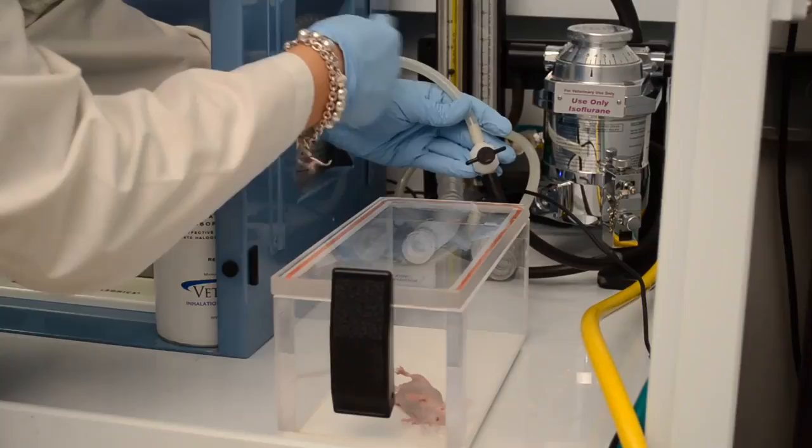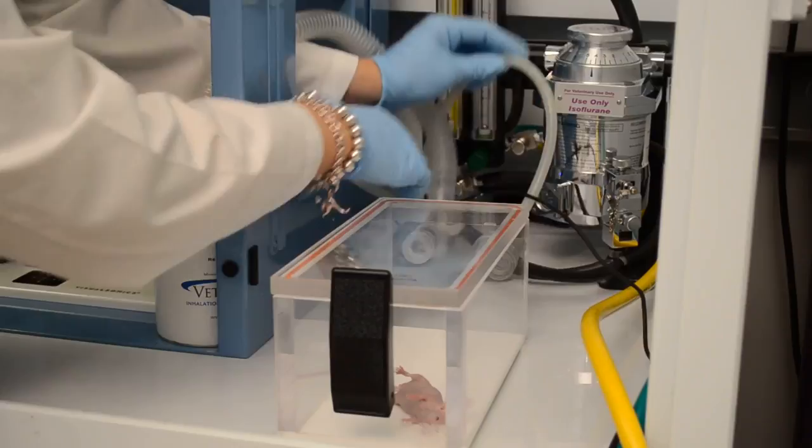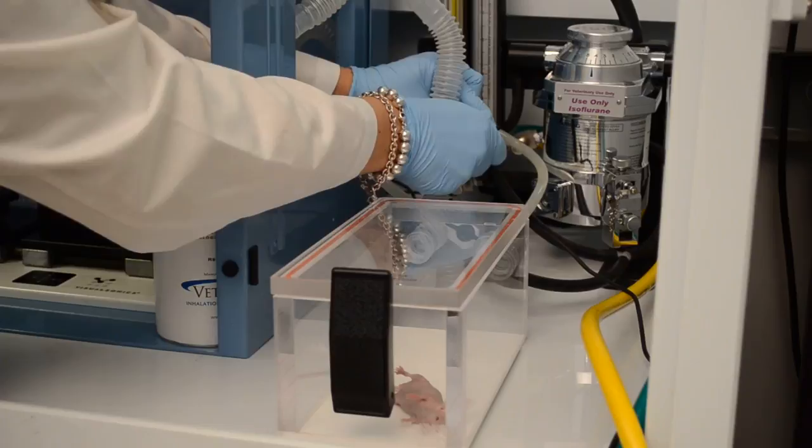The mouse has been placed in the induction chamber for anesthesia using isoflurane gas. For transfer to the imaging platform, we open the anesthesia line to the platform and close the valve for the induction chamber.